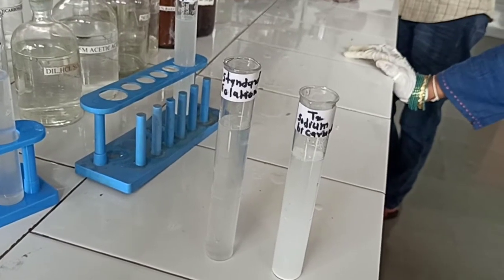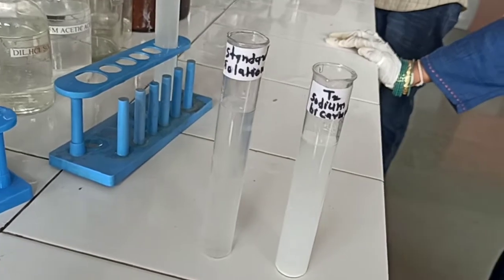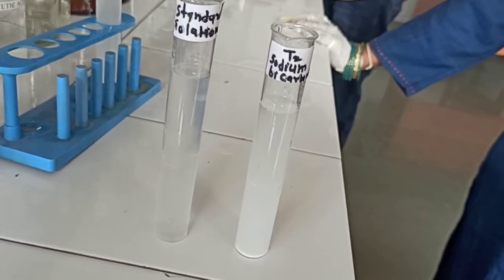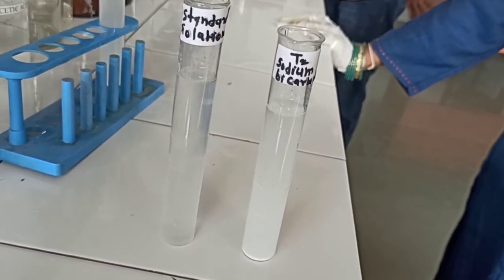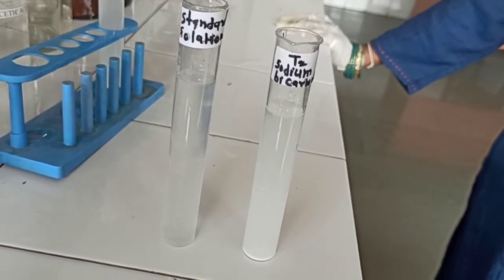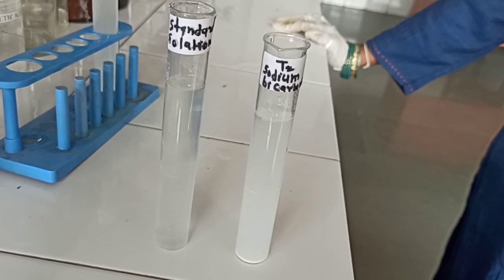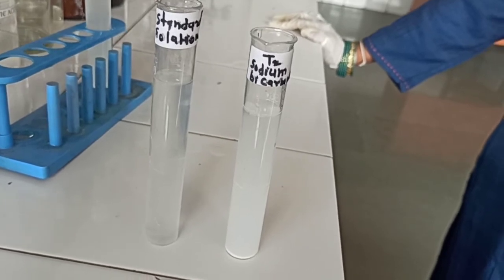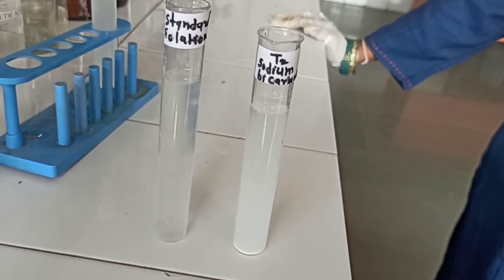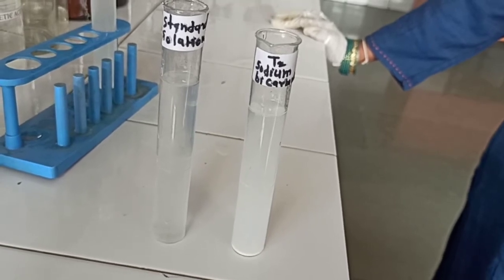Comparing the standard solution with the test solution of sodium bicarbonate, the opalescence produced in the test solution of sodium bicarbonate is more than that of the standard. Therefore, the sodium bicarbonate sample does not comply with and does not pass the limit test for sulfate as per IP.